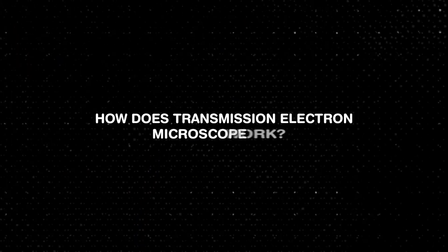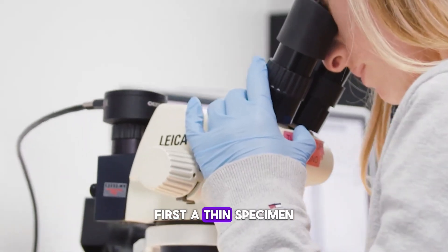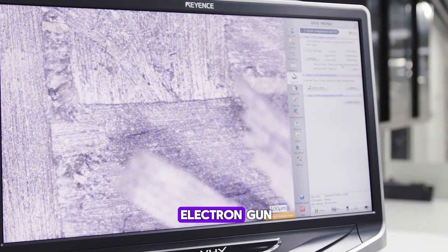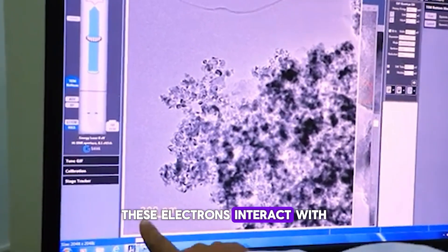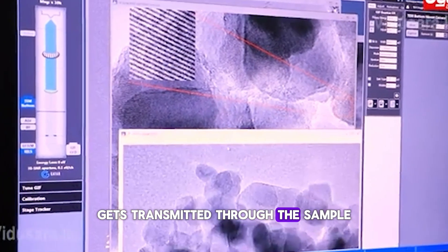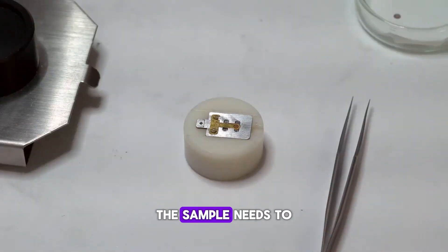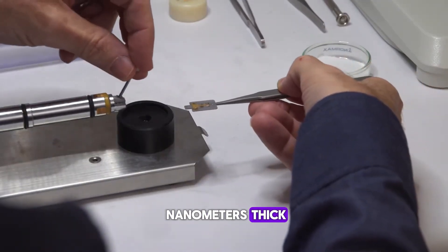How does a Transmission Electron Microscope work? Let's take a quick look. First, a thin specimen is placed in the microscope. The TEM's electron gun then shoots a beam of electrons through the sample. These electrons interact with the material, producing an image based on how much of the electron beam gets transmitted through the sample. Because the electrons pass through the specimen, the sample needs to be incredibly thin — usually less than 100 nanometers thick.